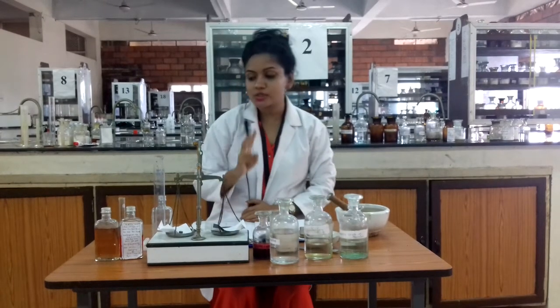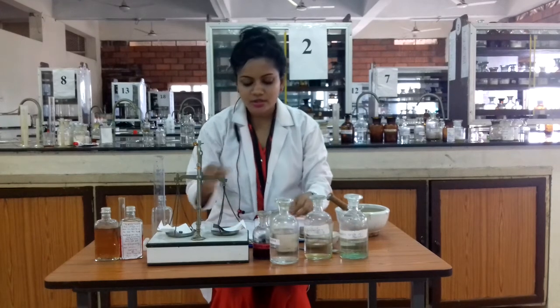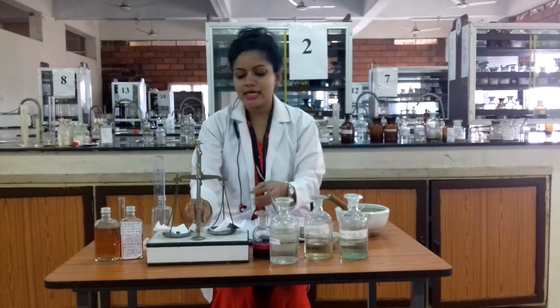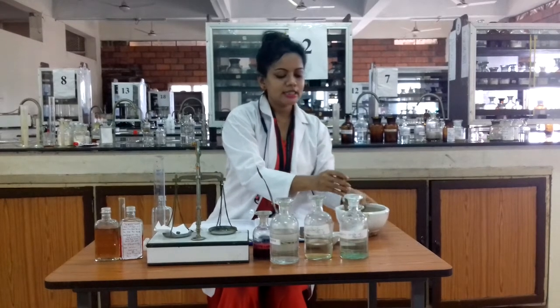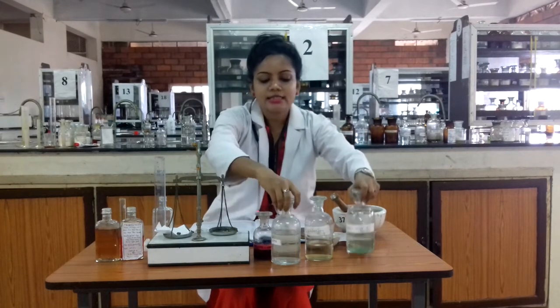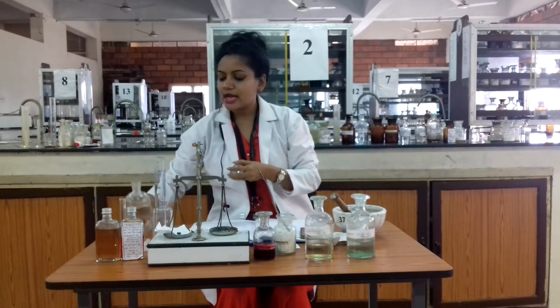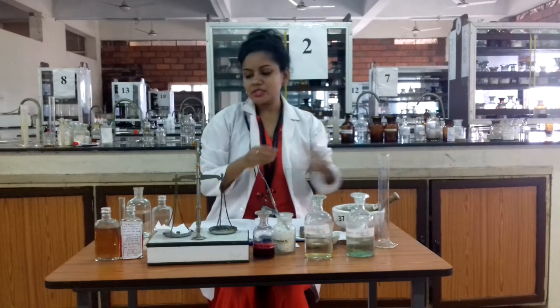We are going to prepare a two-dose carminative mixture. For two doses we need 2 grams of sodium bicarbonate, which acts as the systemic antacid. We transfer the sodium bicarbonate to our mortar and pestle, which is mainly used for mixing purposes. Peppermint water acts as the vehicle and provides good flavouring action. First we dissolve the sodium bicarbonate with three-quarters of the peppermint water, then add it to the mortar and mix very well. This helps in dissolving the mixture thoroughly.